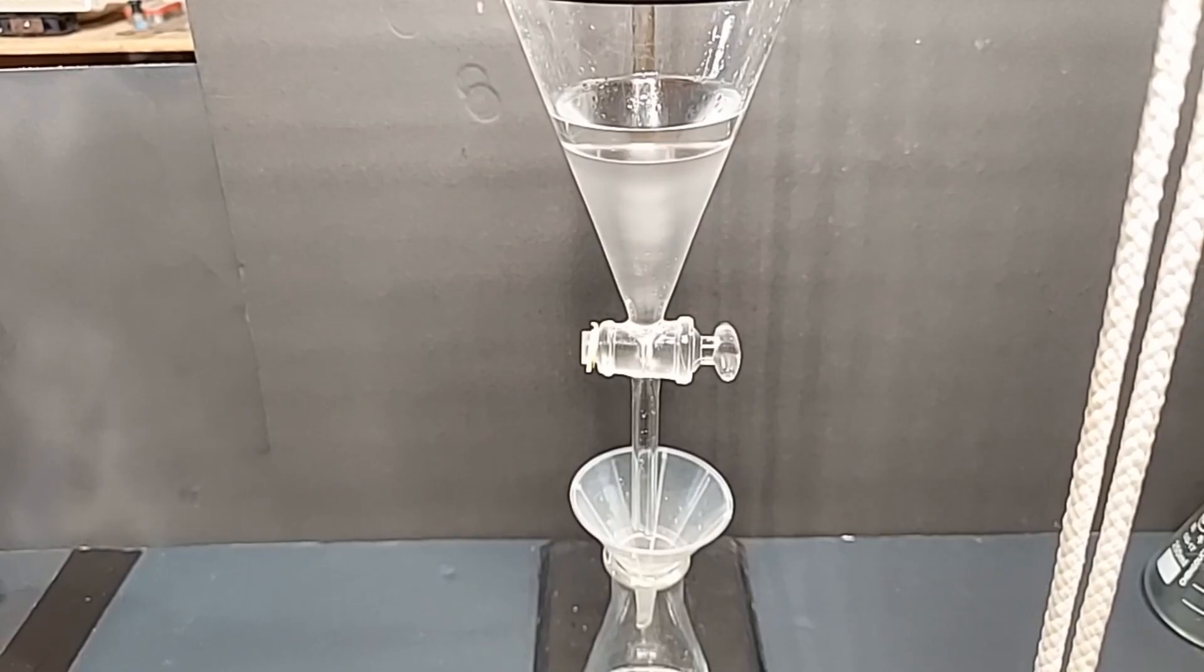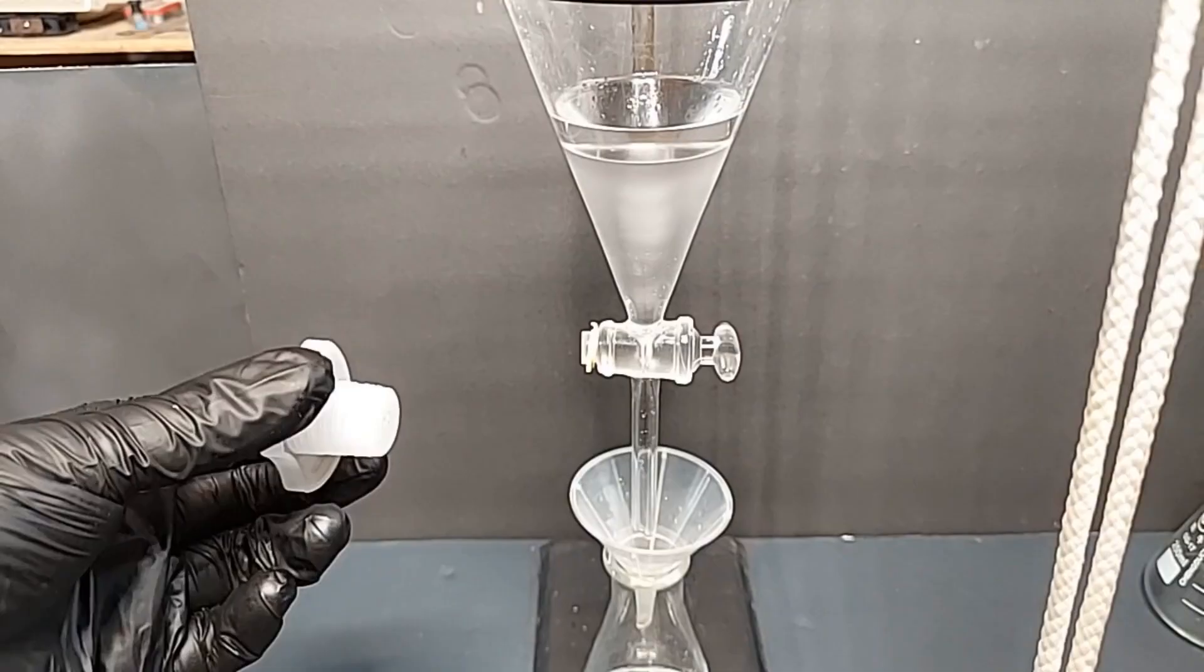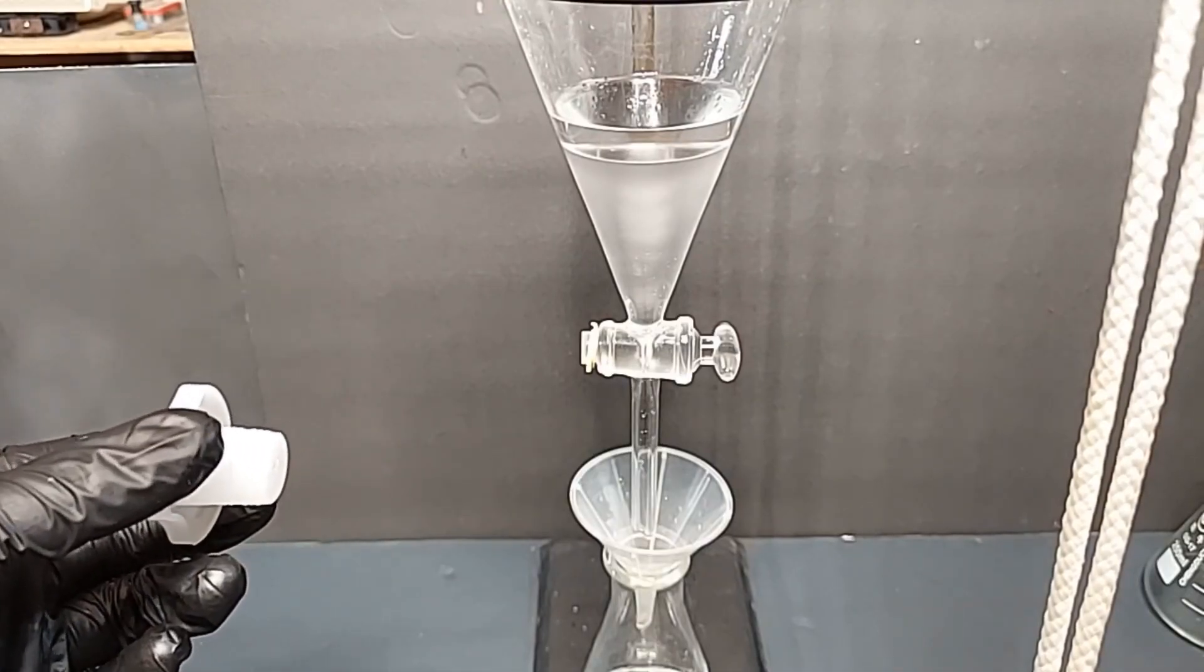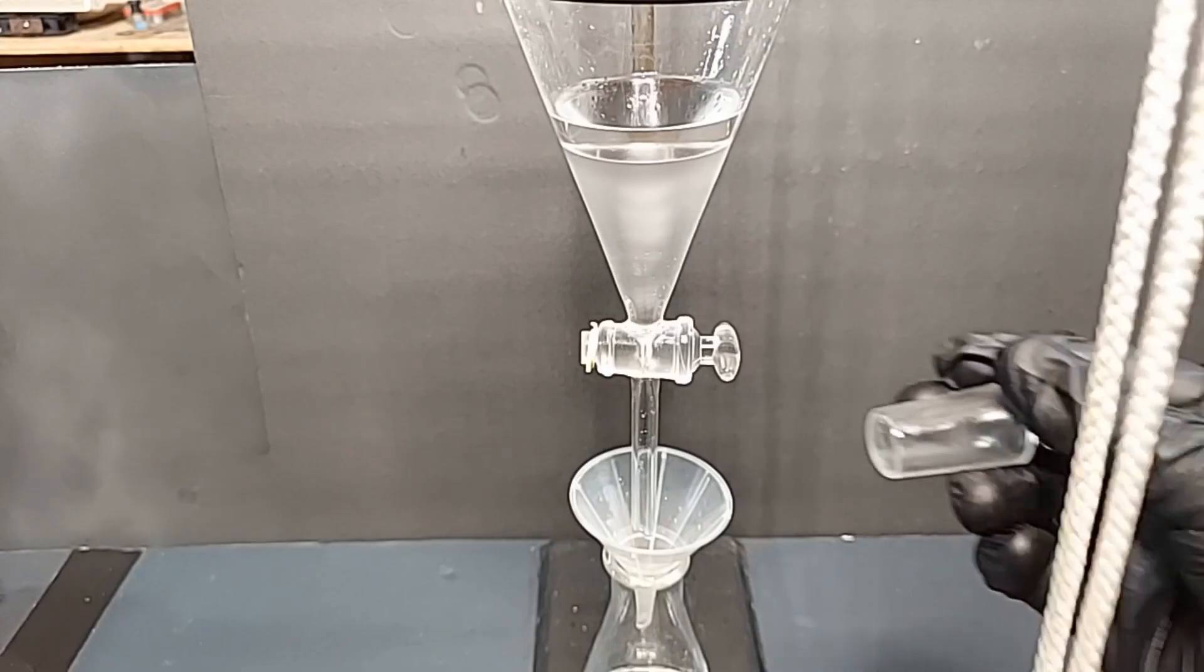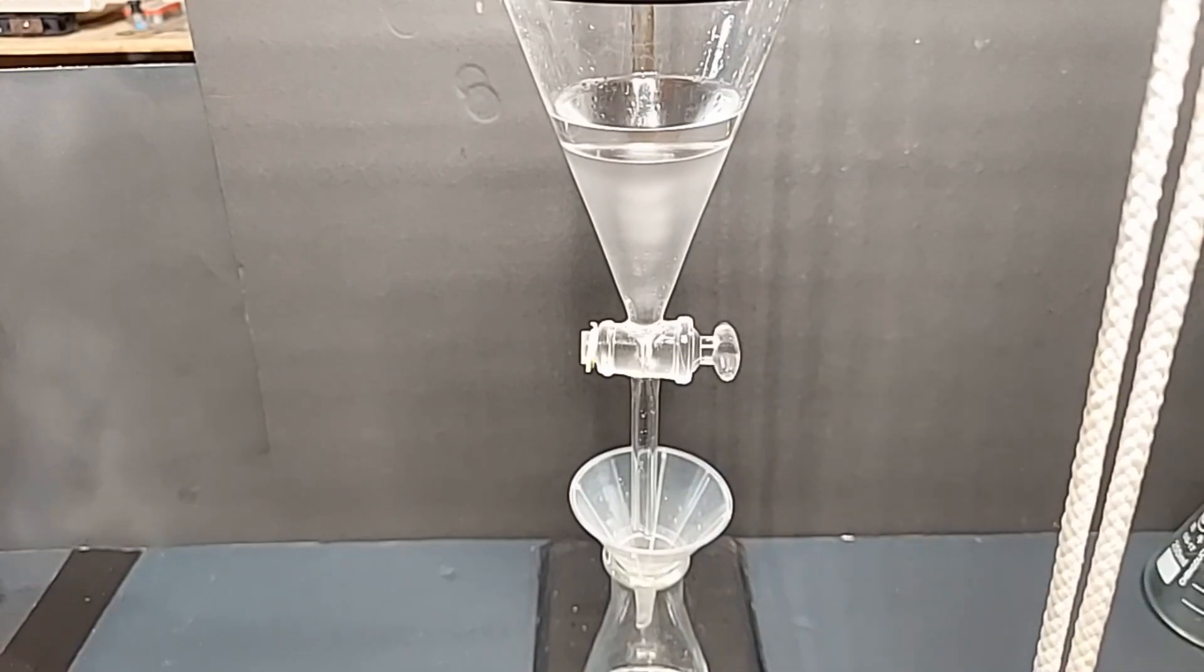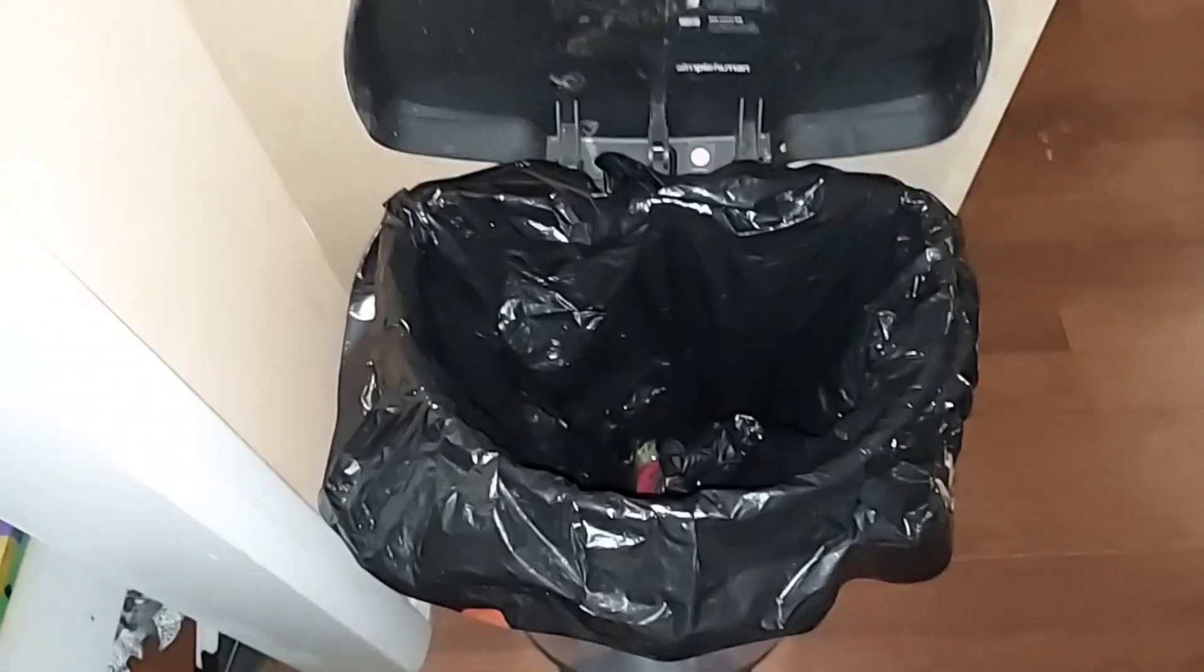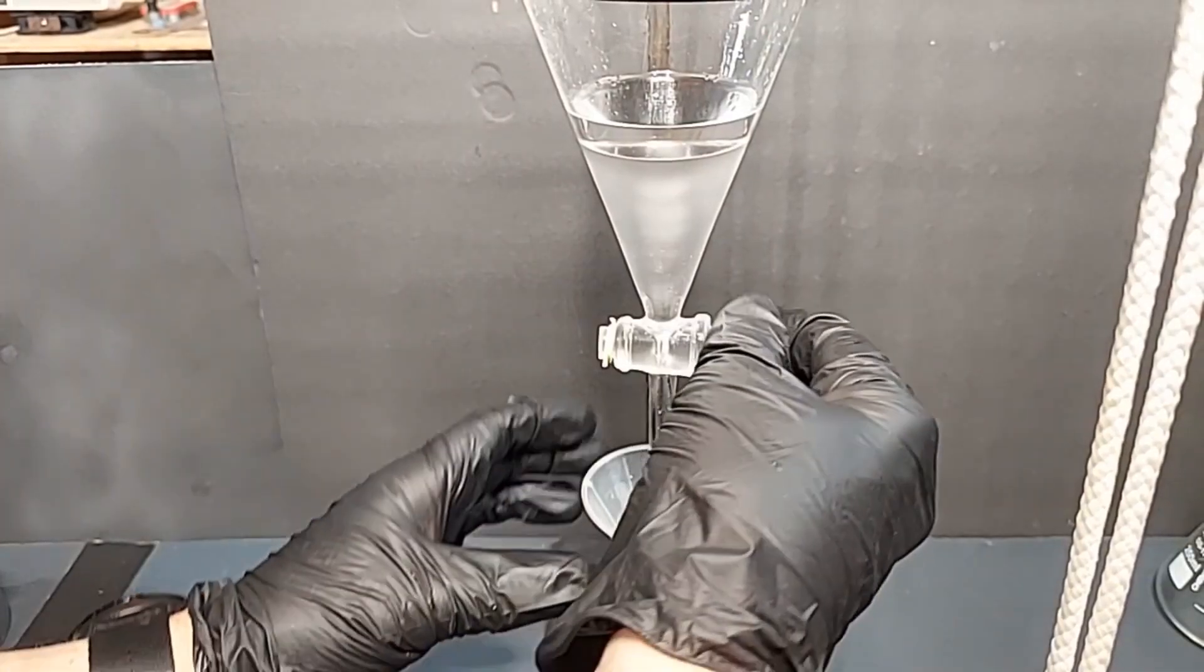I just finished the second wash with the sodium bicarb solution. I haven't drained it yet, but I had an unfortunate mishap. The separatory funnel came with this as a cap for the top. So I was using this, but during the second wash, I noticed a little bit of liquid on my left hand, and eventually I noticed that it was leaking. The ethyl acetate was leaking out and onto the table. I'm guessing I lost 40 to 50 percent of the yield, unfortunately, which evaporated extremely quickly. At least I know it's ethyl acetate. I eventually switched over to a glass stopper here, and it worked fine. But, yep, that happens sometimes. I'm going to continue on as if we had all of it.